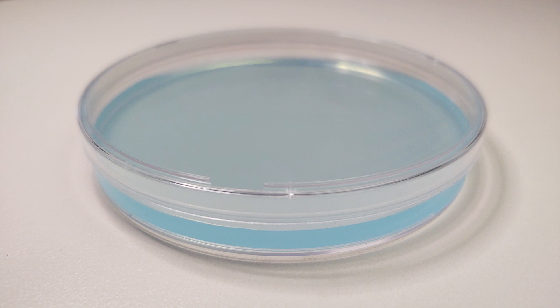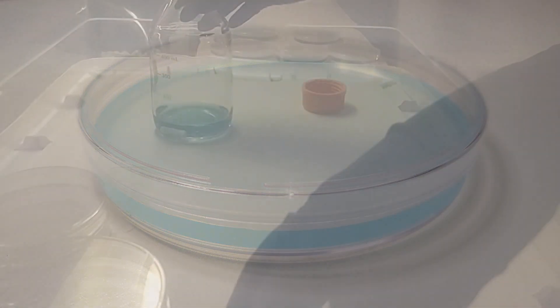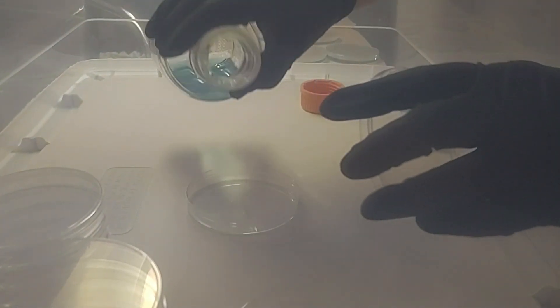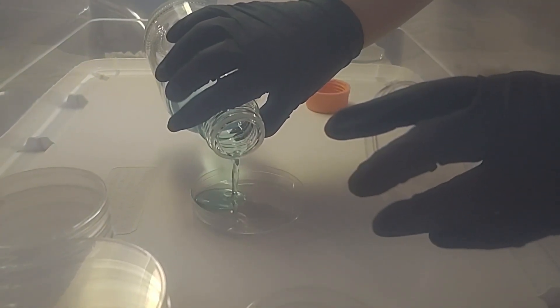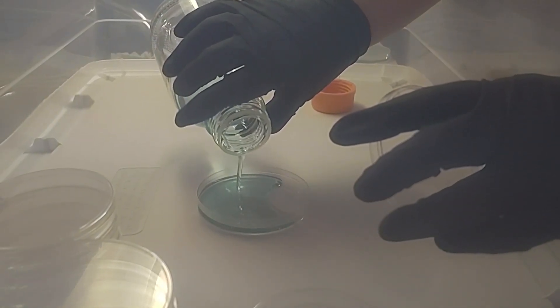Make sure everything is sterilized before pouring agar to plates inside a still air box. Pouring one plate at a time quickly, taking the tops off, pouring and replacing the top before moving on.